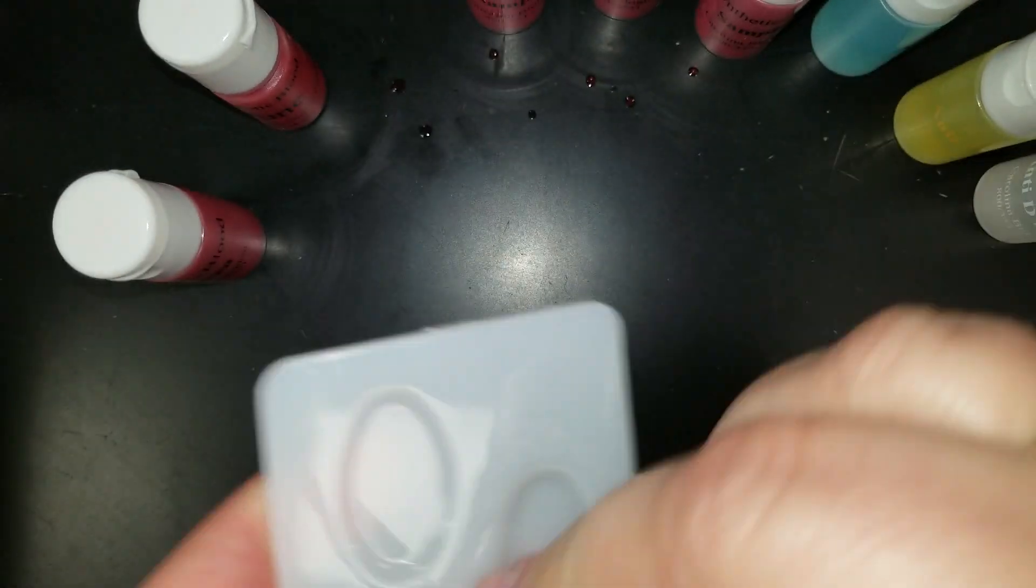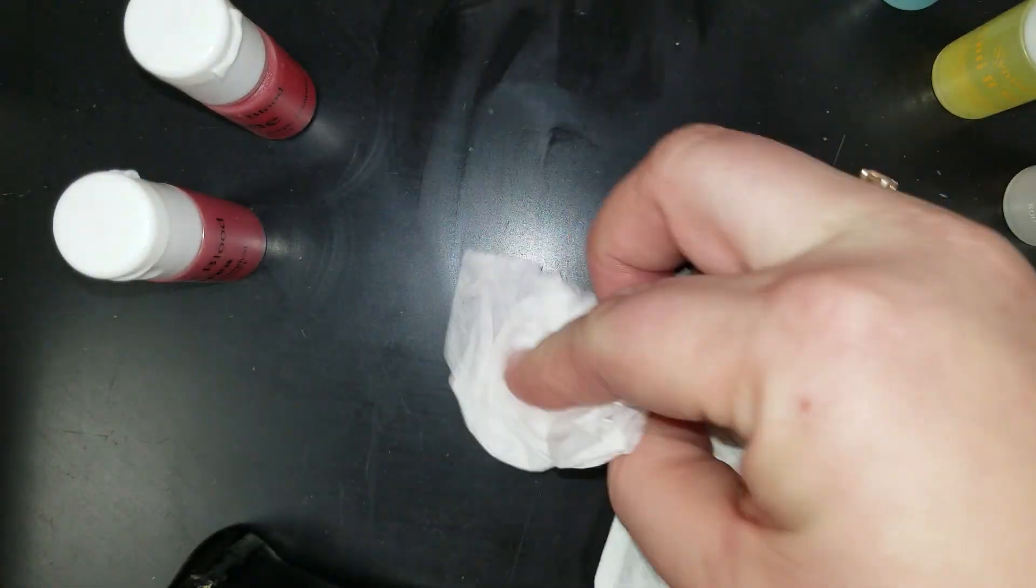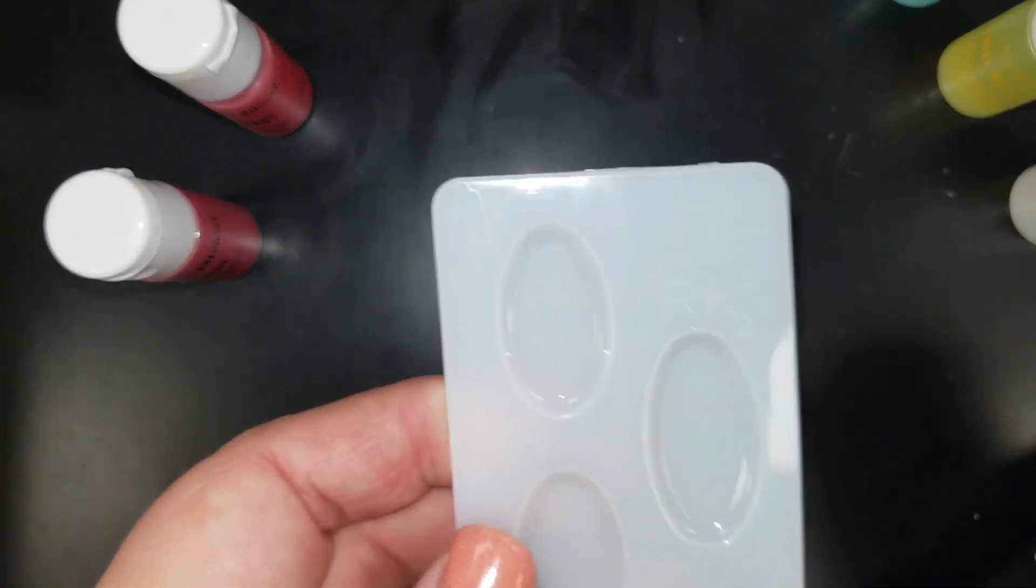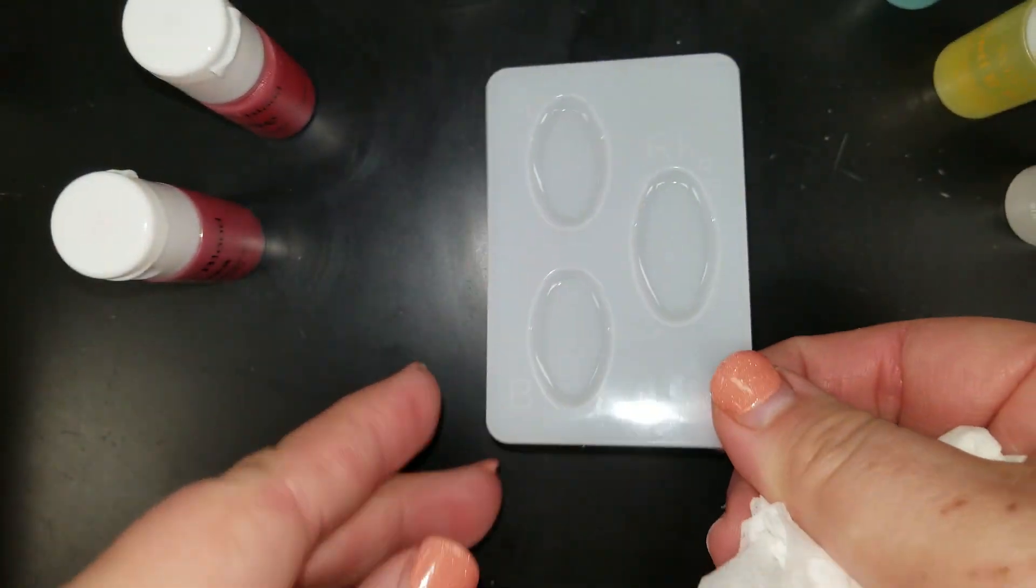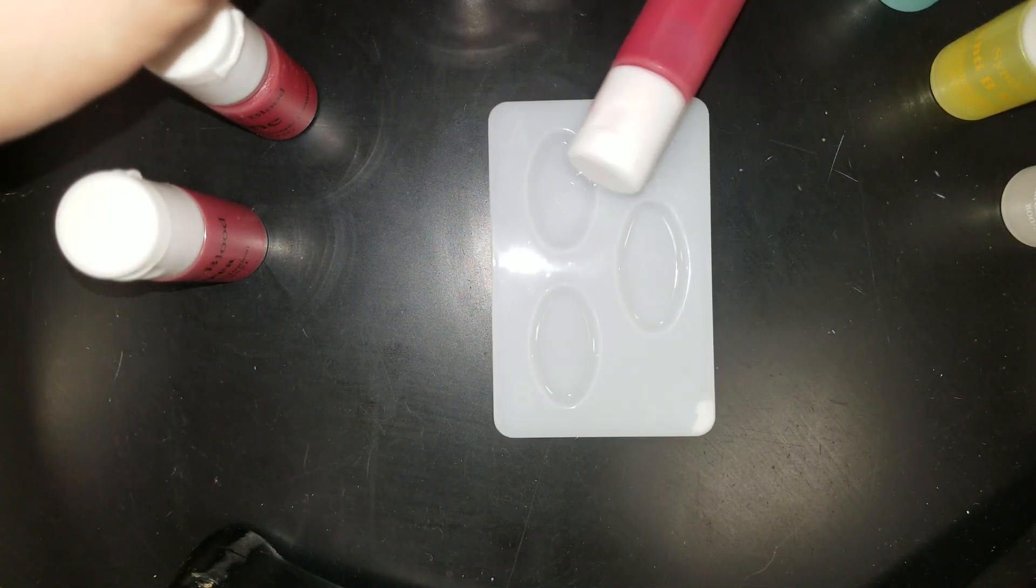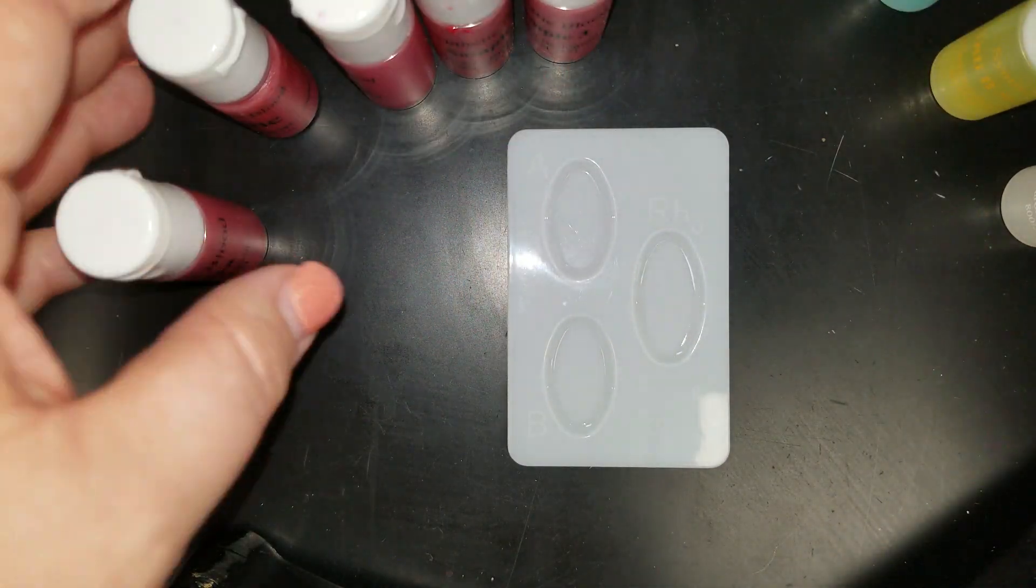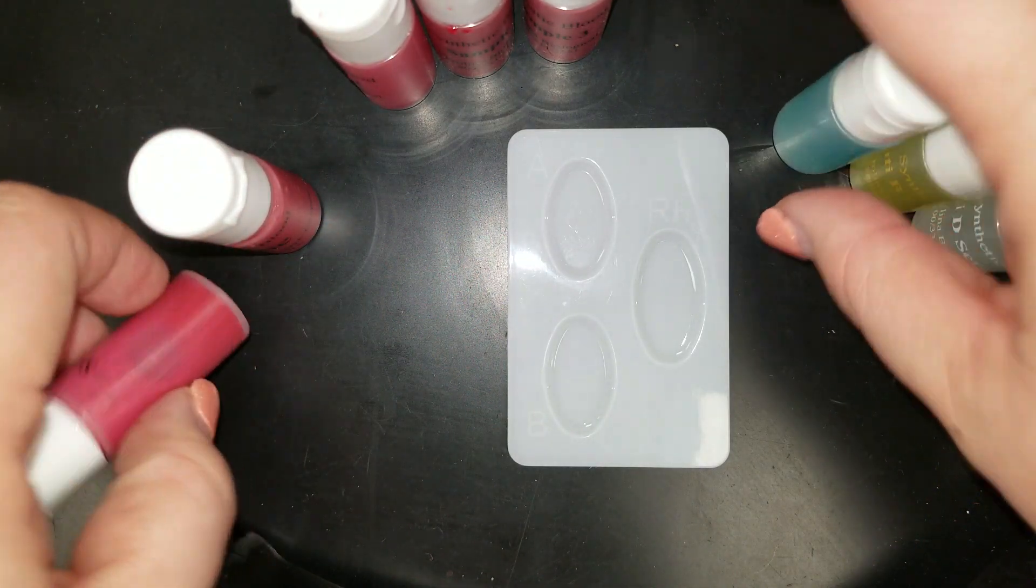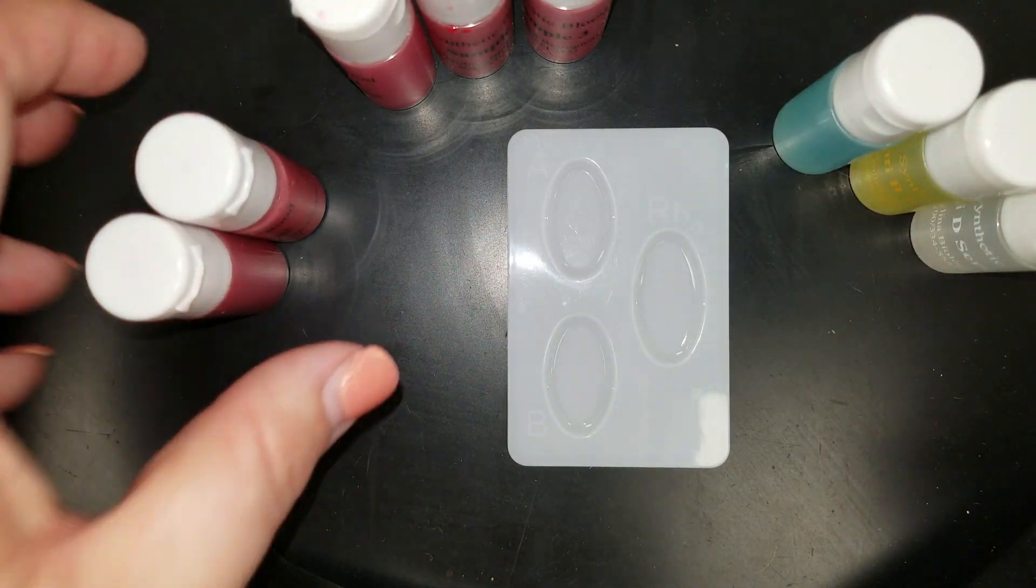So you should be leaving your station. I'll sort of clean up these little droplets that I got on the lab table here. You should be cleaning them up so that you're ready. And our lab is once again reset. We're ready for the next either the next test, or we're ready for the next group that's going to come in.